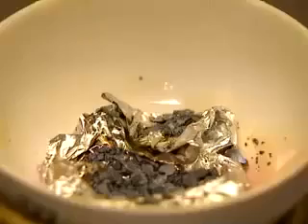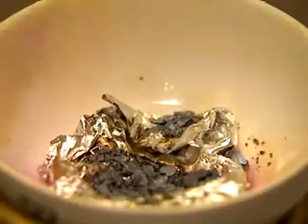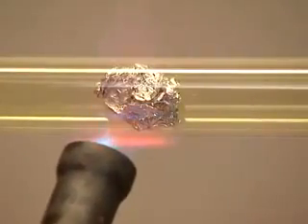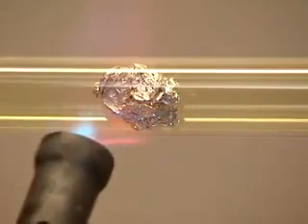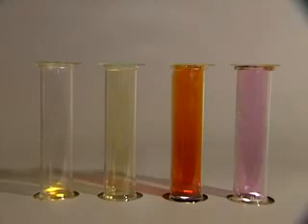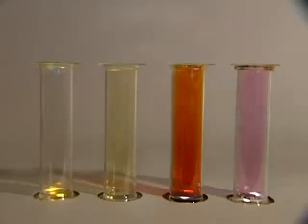The reaction with iodine is just as spectacular. A little warming helps to get things moving, but once the reaction's off, it needs no further assistance. The products of all four of these reactions are white solids, and they're all trihalides: AlF3, AlCl3, AlBr3 and AlI3. Now aluminium is a trivalent element, so in these compounds the halogens are all showing a valency of one. That valency of one is also satisfied when the halogen atoms bind to one another in the diatomic molecules with which I started this sequence.